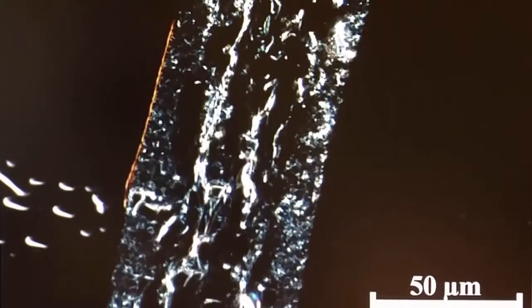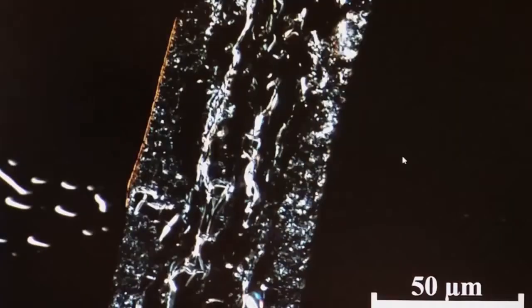Okay, so here I put up the dark field image of transmitted light. Now you can see this is the 400 magnification scale again. Now you have the reversed case. Everything that was bright before now becomes black. So it is only the thing that is reflected in the sample that's picked up in the objective. And here you can see this small yellow stripe, that's the printed ink, of course. Now you remember that the printed ink was black before, now that is the reflecting piece here. And of course it's printed silver, so it should be reflective, right?